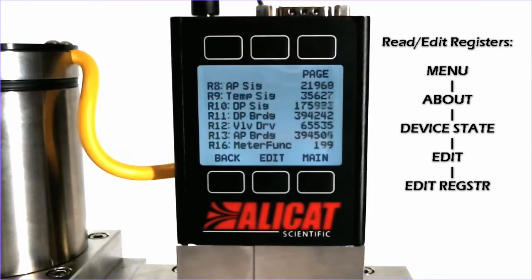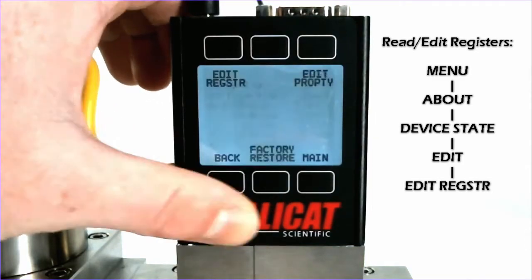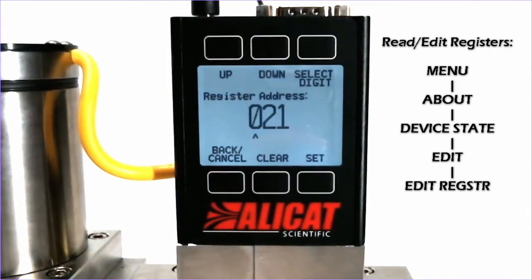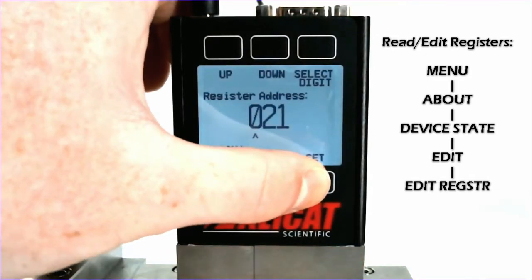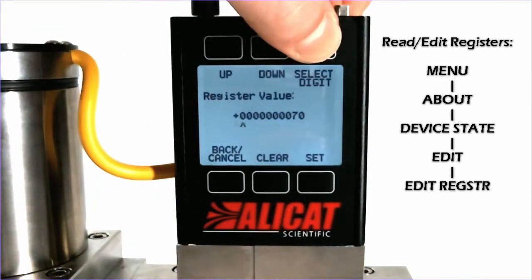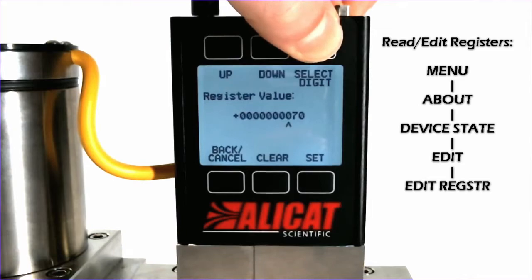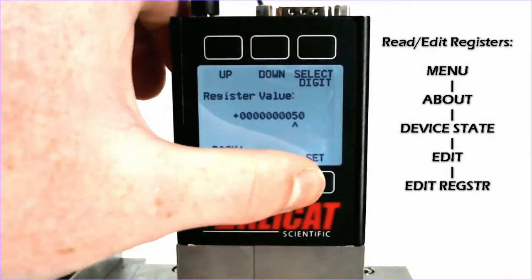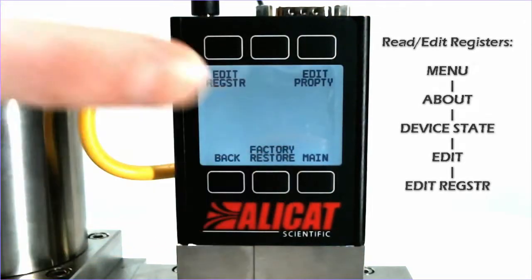In order to edit any of these registers, we will hit Edit, Edit Register, and since 21 is already selected we will change that to a value of 50. And that is how you edit registers.